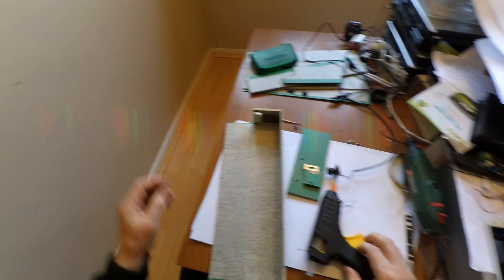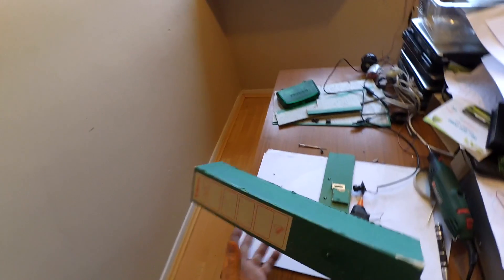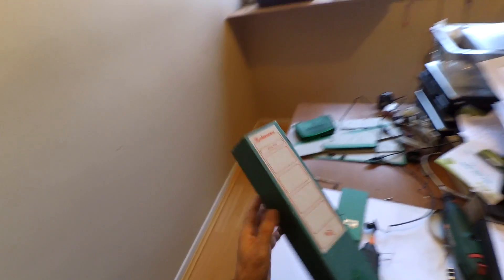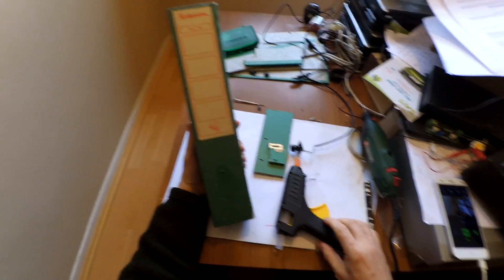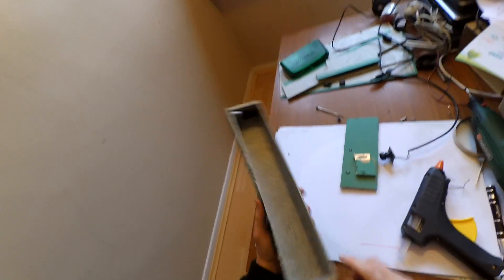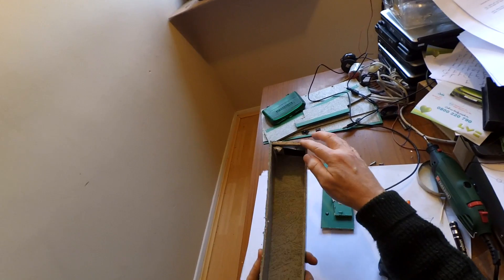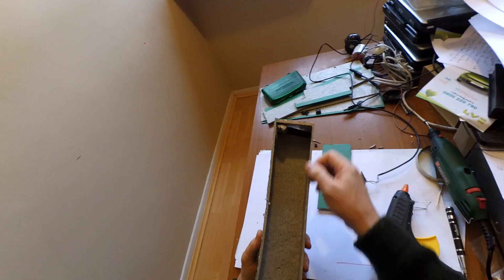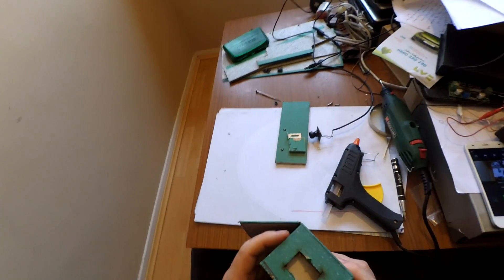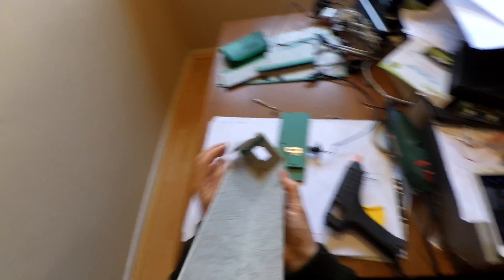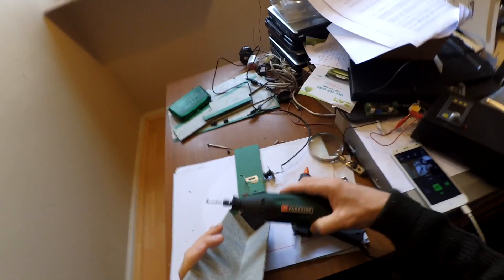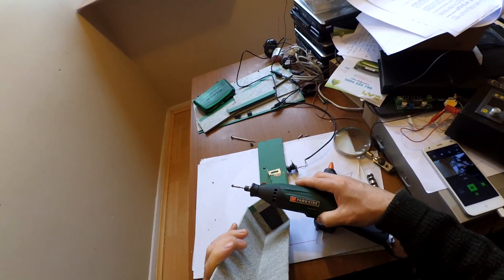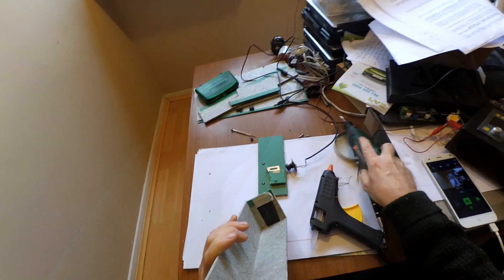Well, the rest of the project is really just this box. You may recognize it's a box file. The long edges are made of chipboard, and the front and back are made of cardboard. There's a square hole cut in one end which will hold the slit through which light will come in. And that's pretty much it.